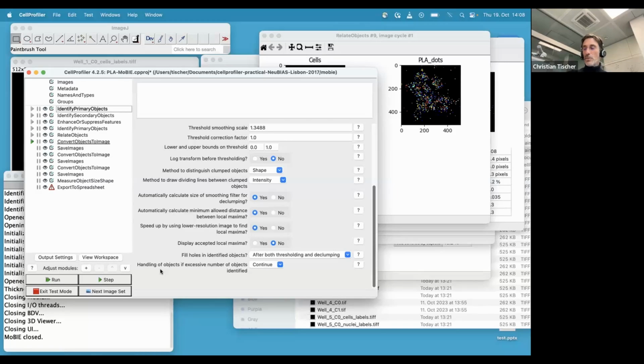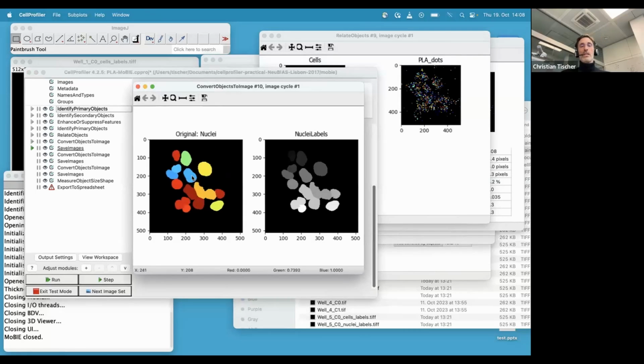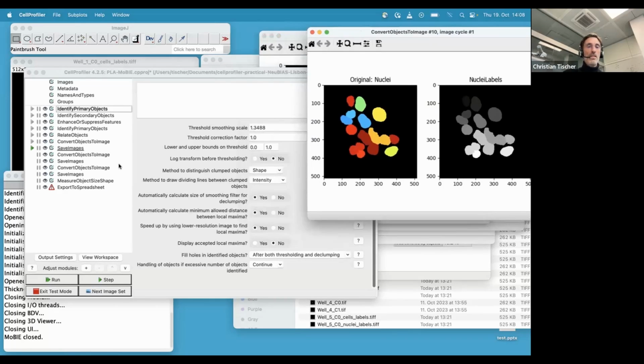Okay, and now comes some stuff that you might maybe not always do when you use CellProfiler, but you have to if you want to do what we will show today. And that is, you have to convert these objects, which CellProfiler internally stores somehow, to a label mask image, where I guess maybe most of you know, all the pixels that are object number 2 have an intensity of 2. Object number 6 have an intensity of 6. So a very typical format how you store segmentations.